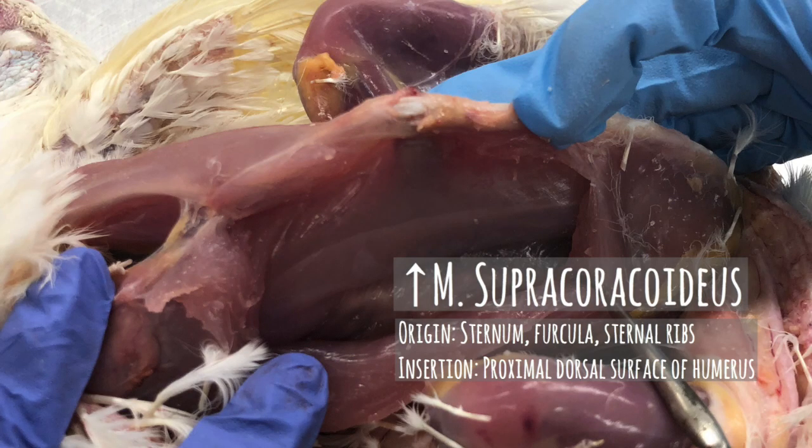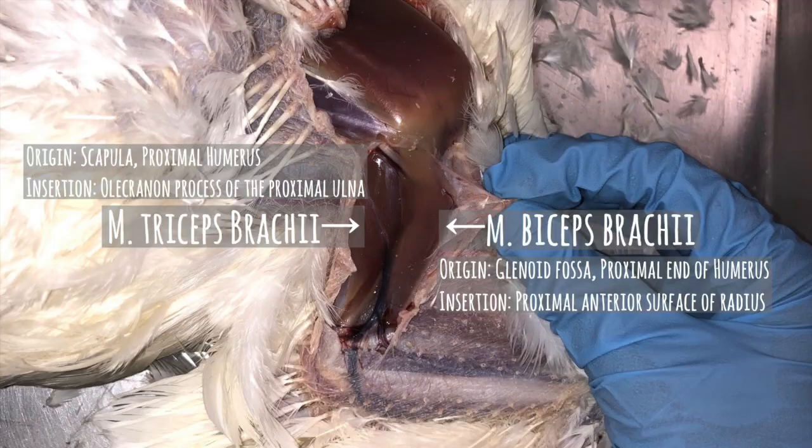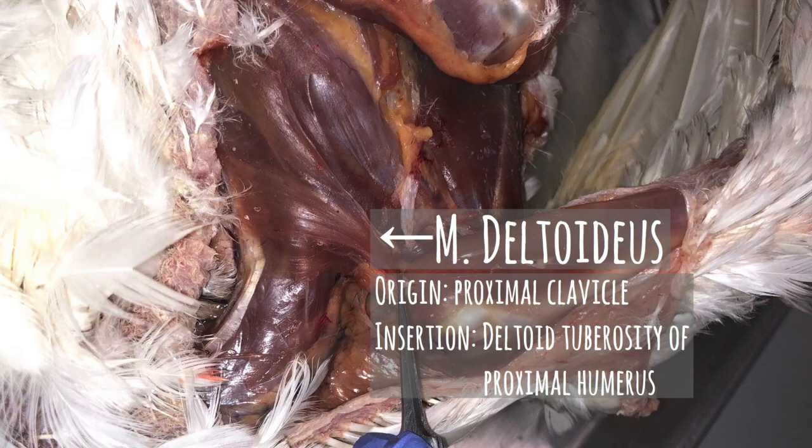We have the M supracoracoideus, which elevates the wing, and the M biceps brachii, which is the flexor of the wing. The M triceps brachii is the flexor of the shoulder and allows for the extension of the forearm. The M deltoideus is the flexor of the shoulder also, but rotates the wing outward.